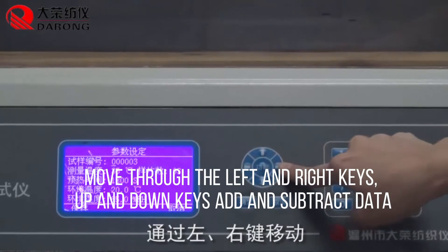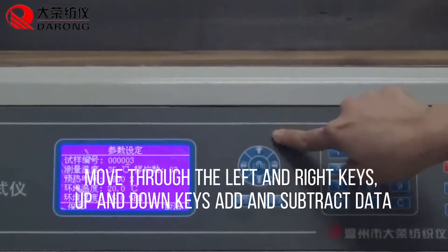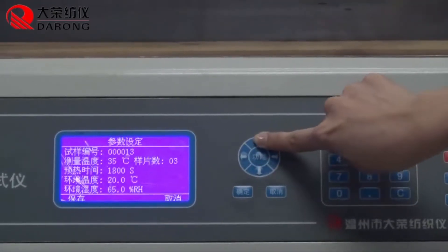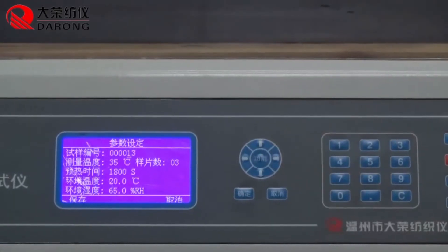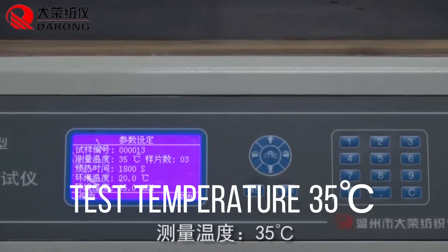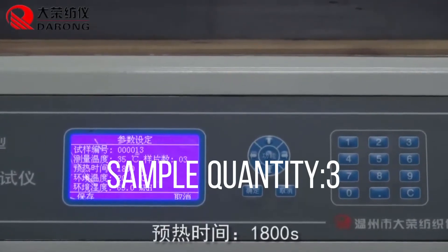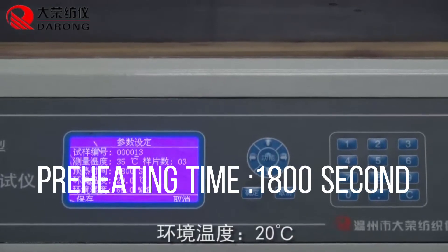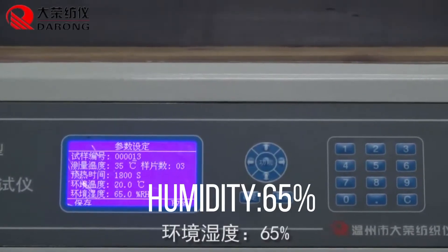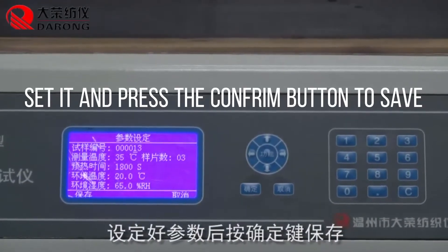Move through the left and right keys, and up and down keys to adjust and input data. Set the test temperature to 35, sample quantity to 3, preheating time to 1800 seconds, and humidity to 65. Press the confirm button to save.